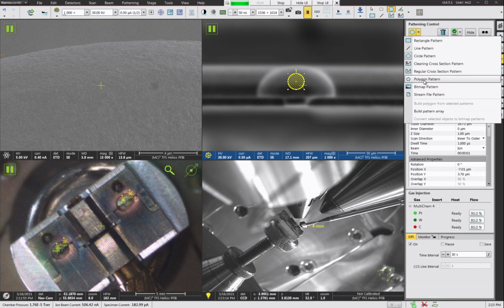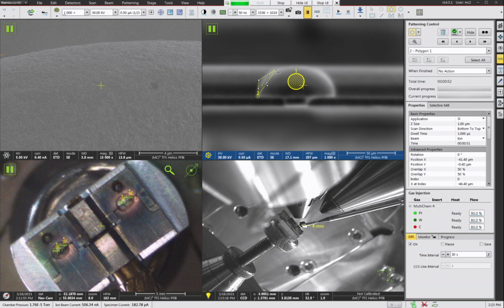And then what I usually do is a polygon pattern, and I try to just create kind of a rough outline of the sample post. This way you're not wasting a lot of time cutting on the extra material. That makes it a little more time efficient. So I would usually make some kind of a goofy mushroom shape like this with the polygon tool. You know, it doesn't have to be absolutely perfect. Just kind of something like this. All right, so good enough.